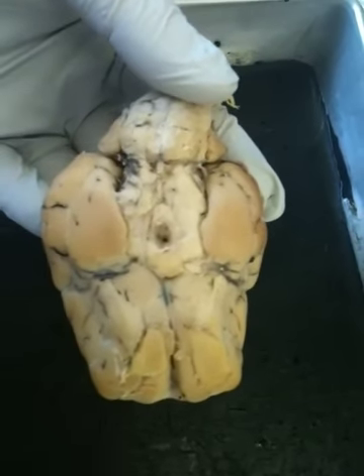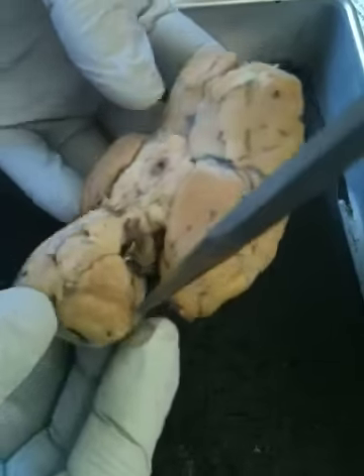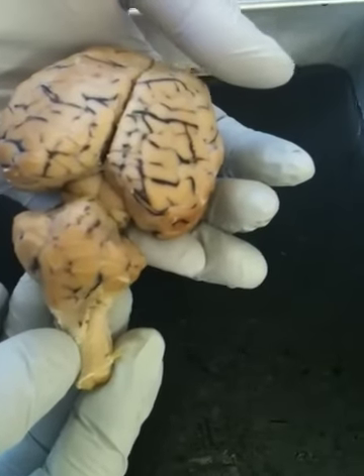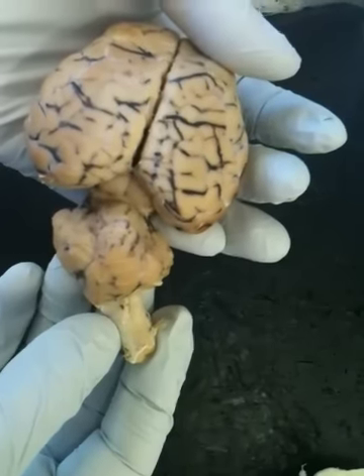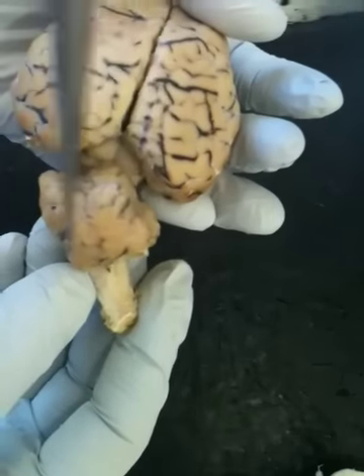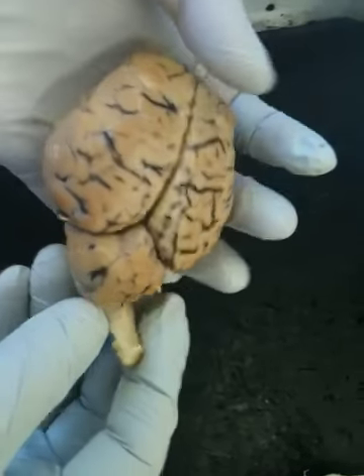The cerebellum is this back bottom chunk. That's the cerebellum. The transverse fissure is the cleft between the cerebrum and the cerebellum. The cerebellar hemispheres are here. There's two. The arbor vitae are within the cerebellum. And it's this tree right here, also known as the tree of life.